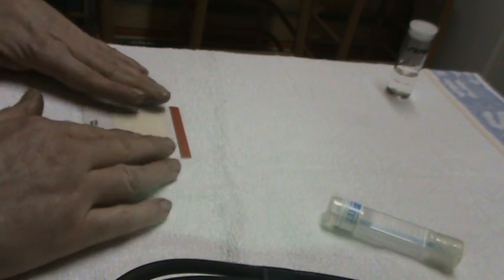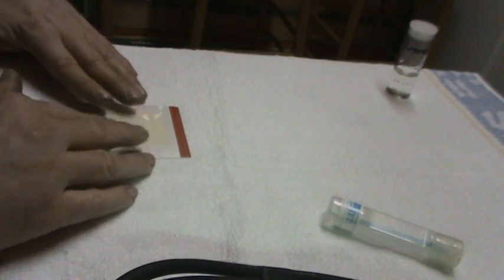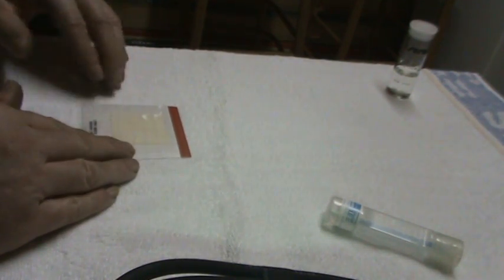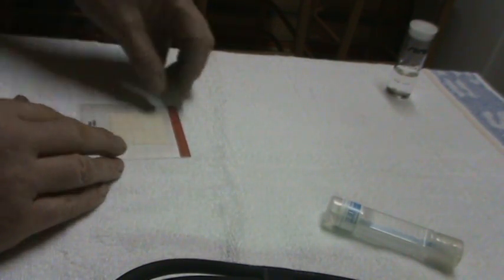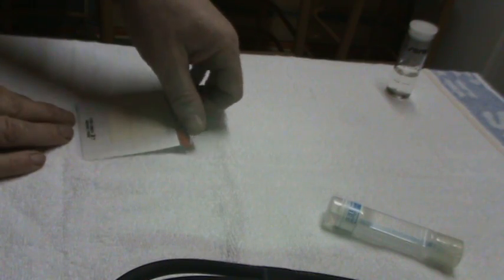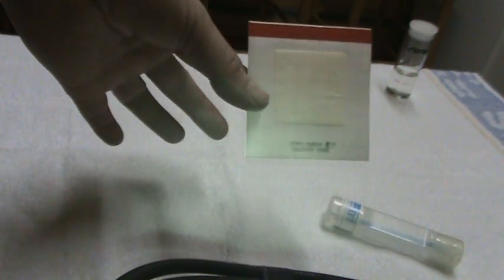I usually do this on a hard surface, so I am going to be pressing them a little harder on a chair, which you won't see. But this is the result.